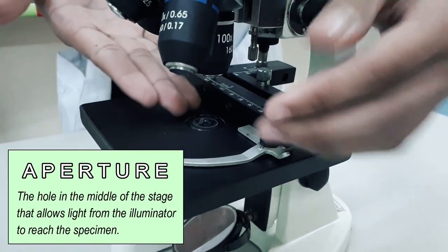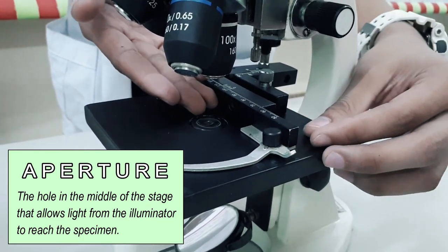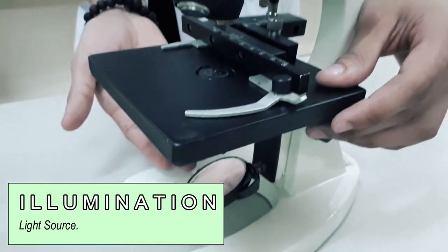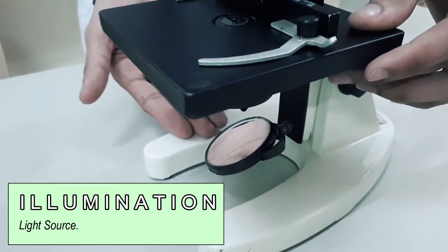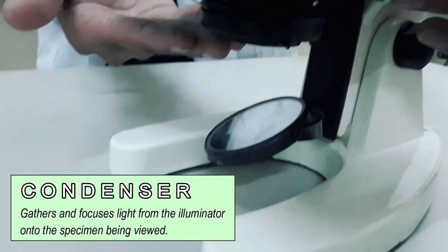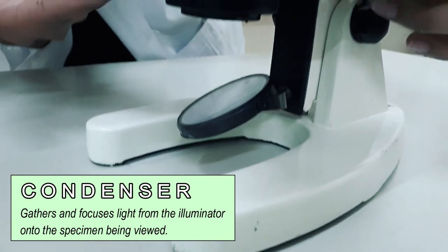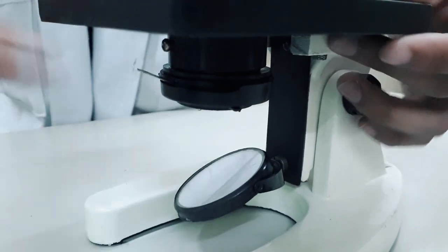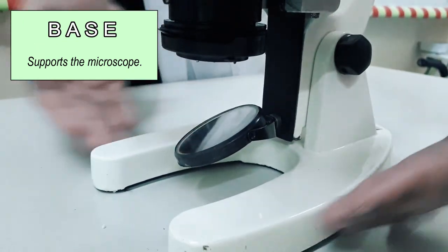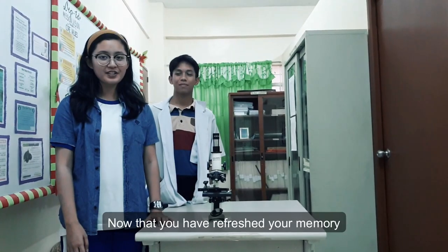This is the aperture — it is a hole in the middle of the stage that allows light from the illuminator to reach the specimen. This is the illuminator — it is the light source. This is the condenser — it gathers and focuses light from the illuminator onto the specimen being viewed. Last is the base — it is used to support the whole compound microscope.